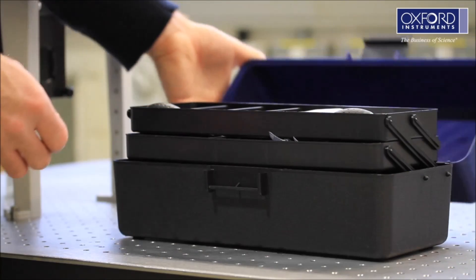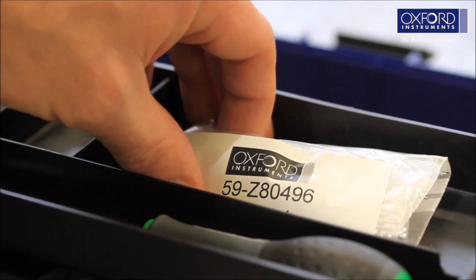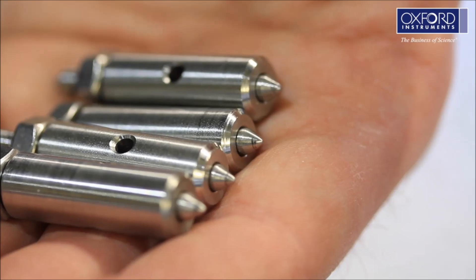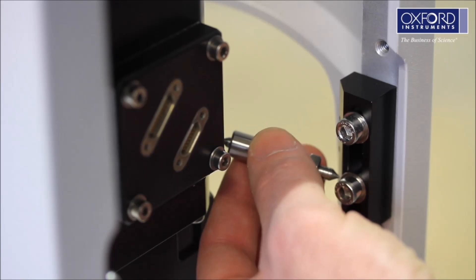In the toolbox, you will find the four radial restraints. Fit the radial restraints between the cryostat and the locator blocks on the stand legs.